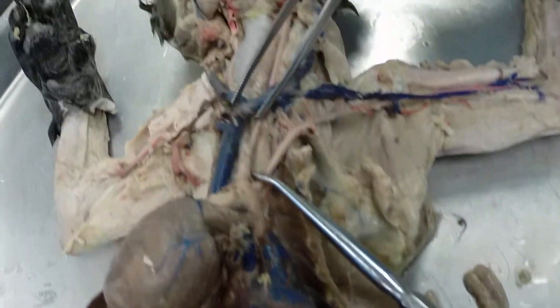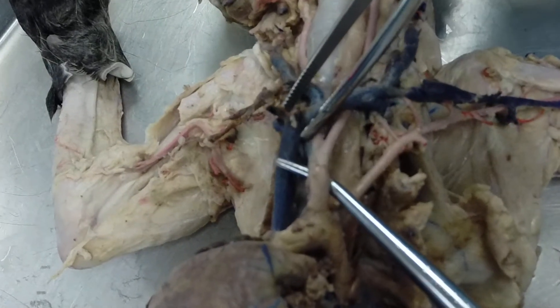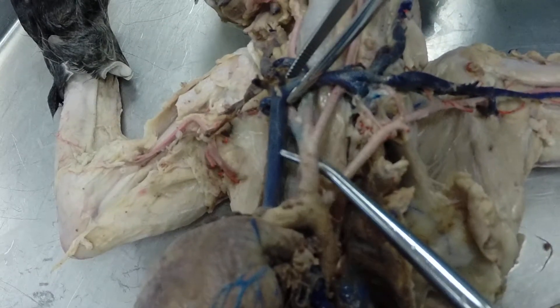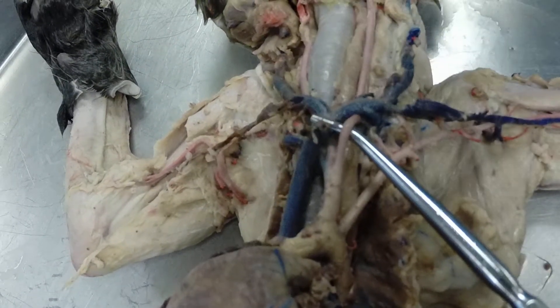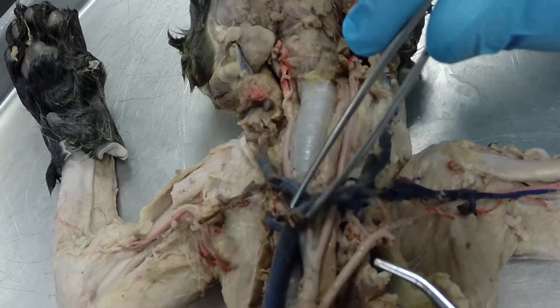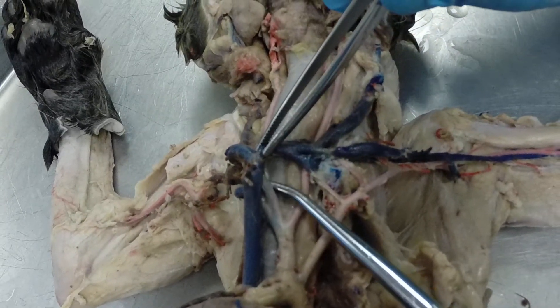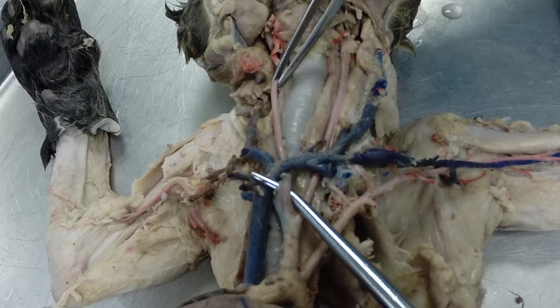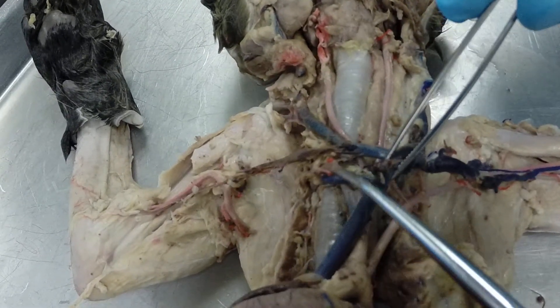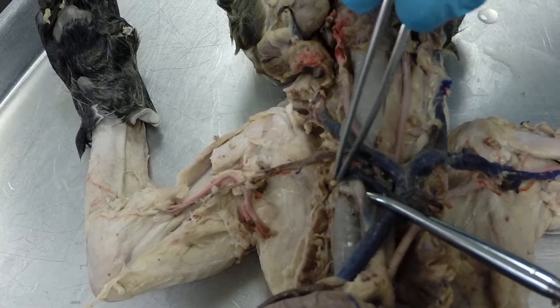Coming off the aortic arch we have two vessels. The first is called the brachiocephalic artery, and the brachiocephalic has three branches coming off of it. The first one is the left common carotid artery, which goes up along the trachea. The second branch is the right common carotid artery, which goes up on the right side of the trachea. The third branch is the right subclavian artery, which continues out across the arm.